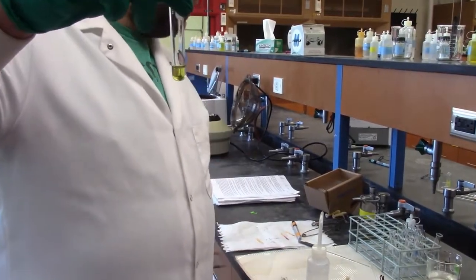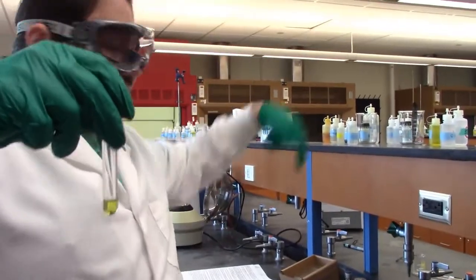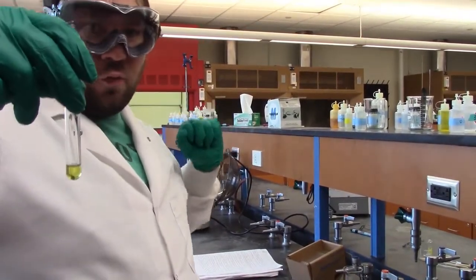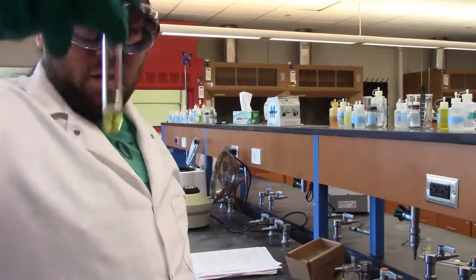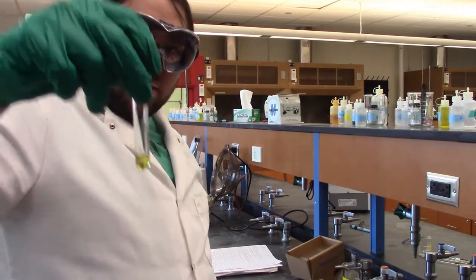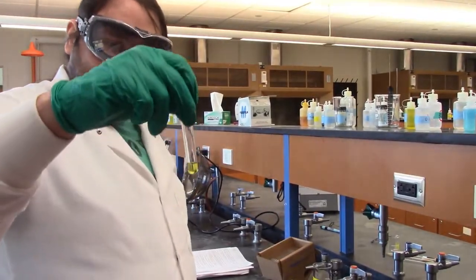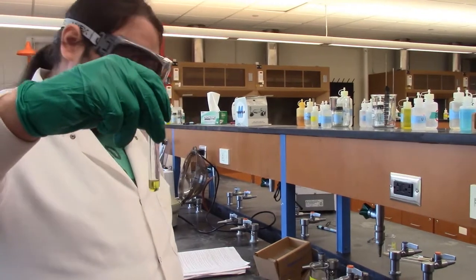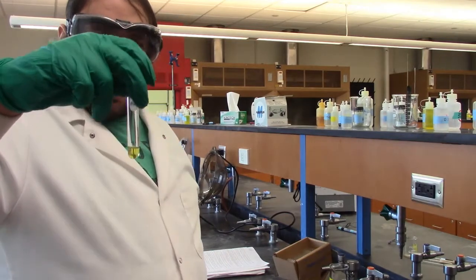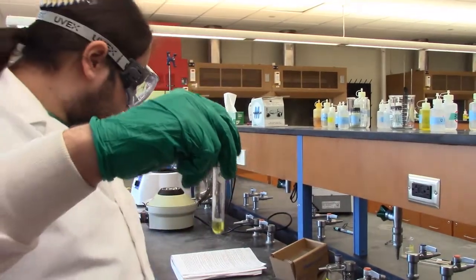Alright, so if you can hear that noise in the background, we decided to do this step while the other stuff is centrifuging. So we're centrifuging our precipitate from before and continuing to wash it and clean it. But here's our complex tin ion. I keep going above the camera, I apologize. And now we're going to acidify it to get the tin sulfide back out so we can confirm that this yellow color is actually tin, not some other stuff.